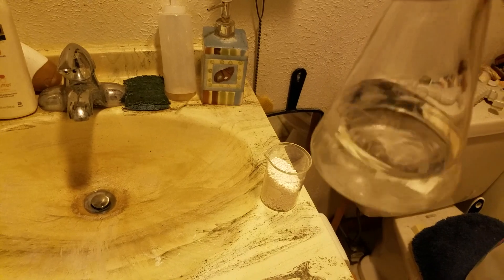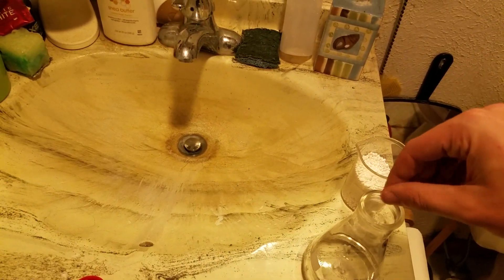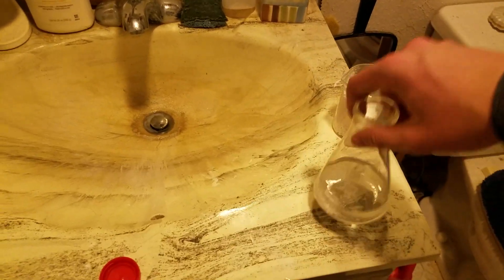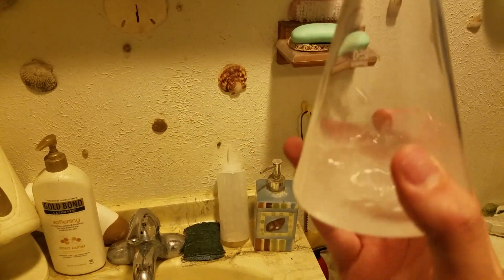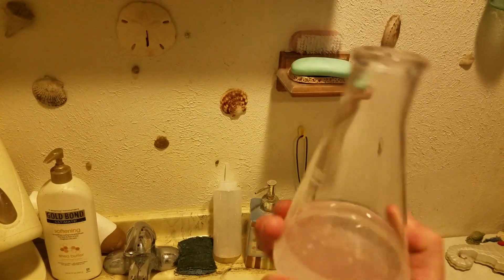We just want to get a saturated solution. This would probably work better if it was ground up. I can actually hear the ringing from it trying to dissolve — kind of fizzling. And just like with any salt, you'll see it start getting milky. It is starting to get a little warm. Theoretically, salts dissolve better in warm water than in cold. I doubt this is true borosilicate glass, because where I bought it was a little sketchy as far as their lab glass went, so I'm not going to try to push that.